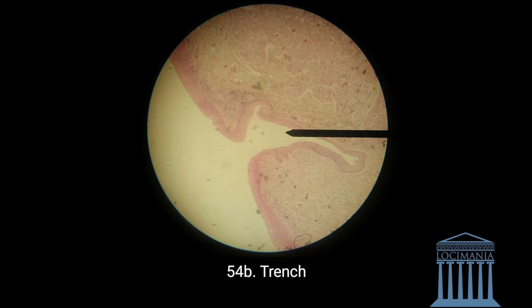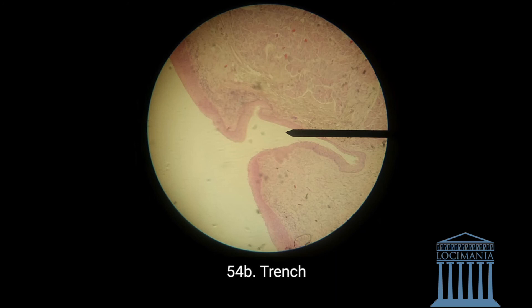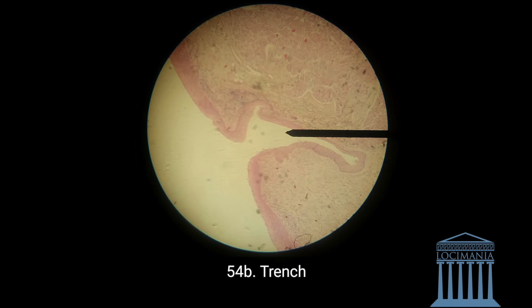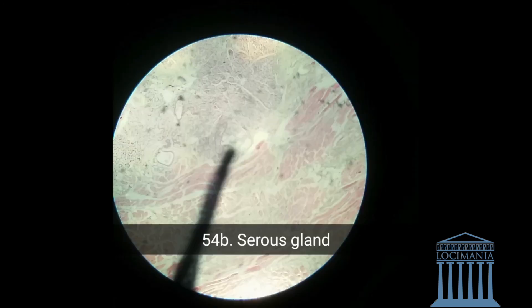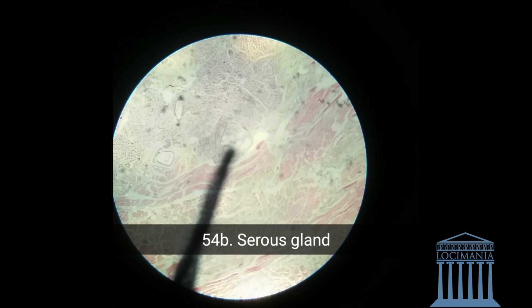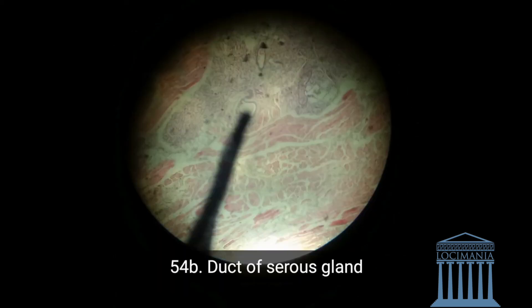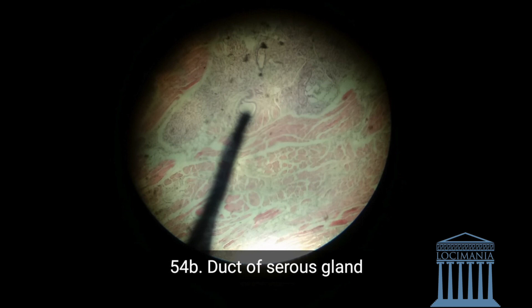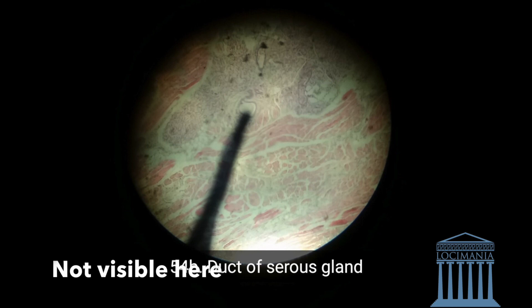The trench is between the two of them, and this circumvallate papillae is flattened or broad, so it doesn't look much like a strawberry but we know what it is. Once again, the trench is the space between two papillae. Going on, we have the serous gland right here — all of that on top is the serous gland. We also have a serous duct, and this is the duct of the serous gland. It is open to the trench, so the duct of the serous gland opens to the trench.